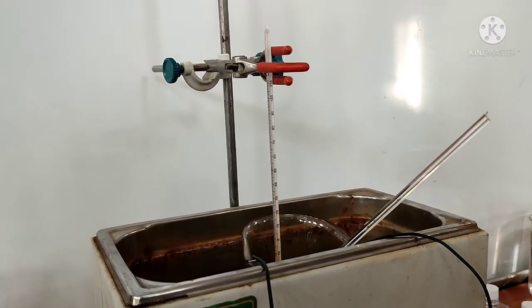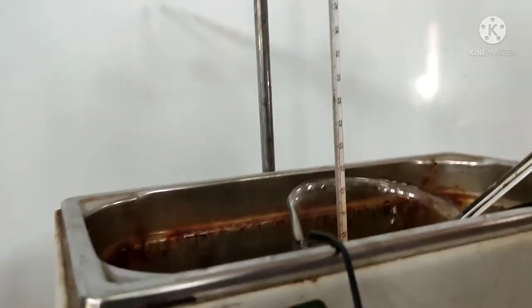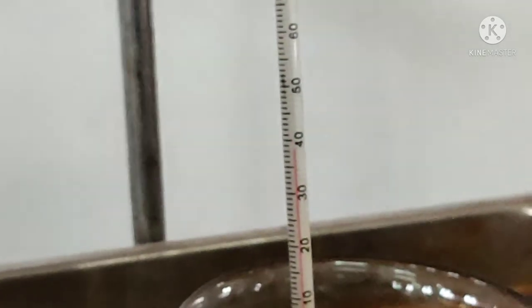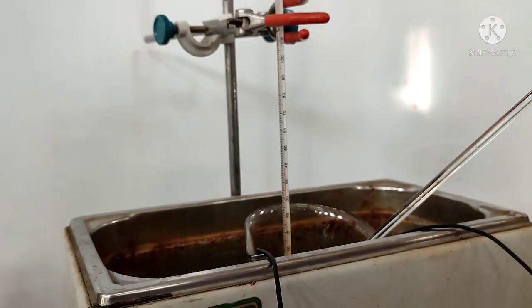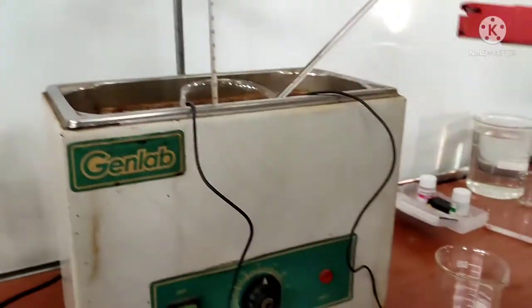For demonstration purposes we are going to take readings only at 40, and then during the experiment the student can take readings at 40, 50, 60, 70, and 80 degrees centigrade as shown in the table.